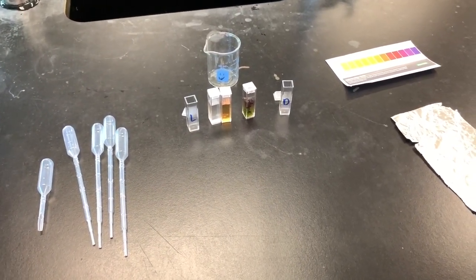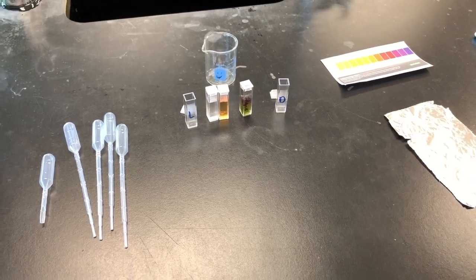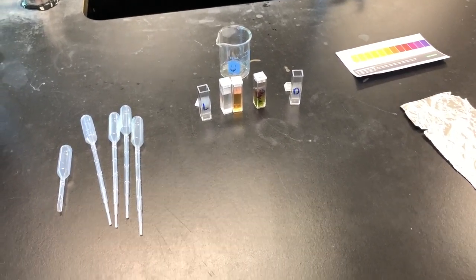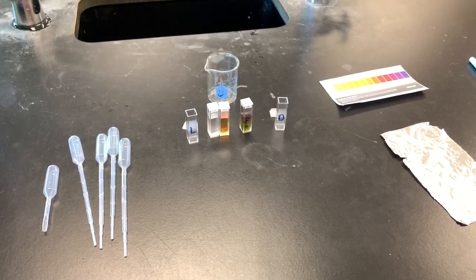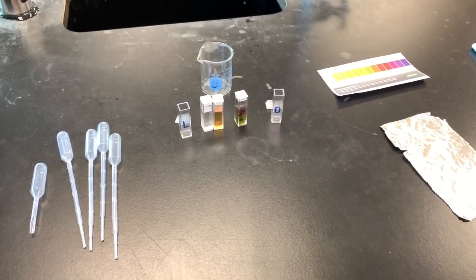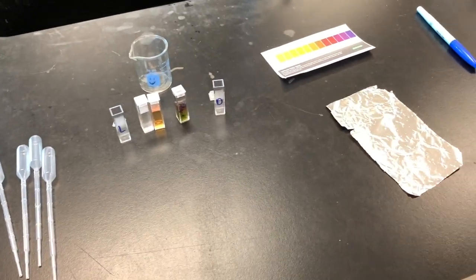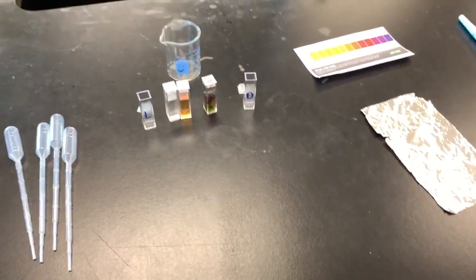So we're going to see a couple things. We're going to see how respiration works, how photosynthesis works, but also how CO2 in water changes pH like we did in the chem review lab. So we're going to start off to prepare our lab. We have to do a couple things.